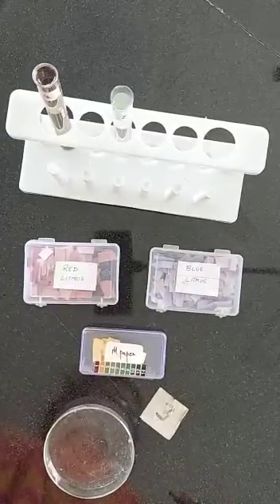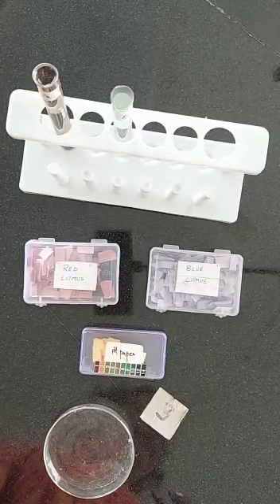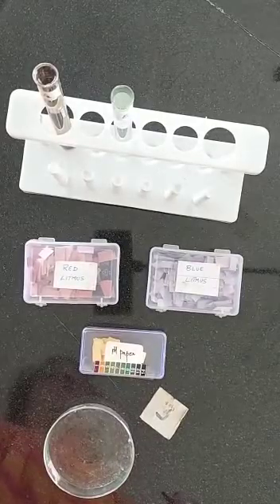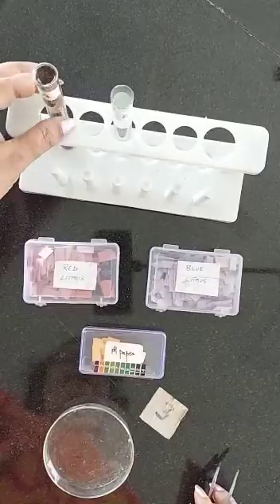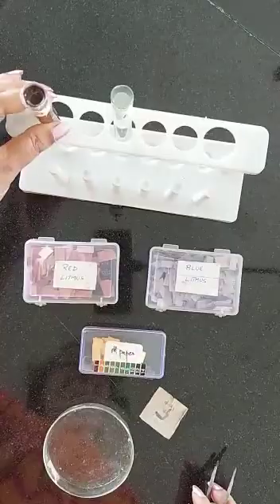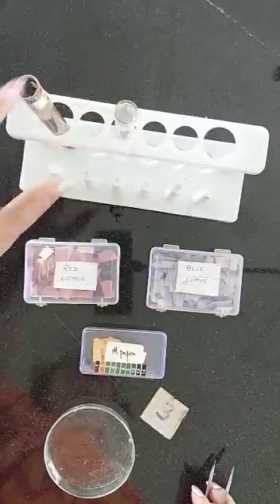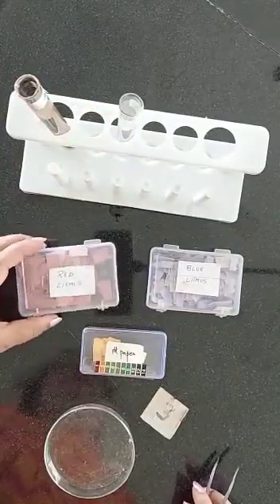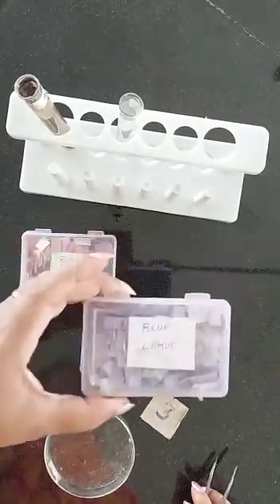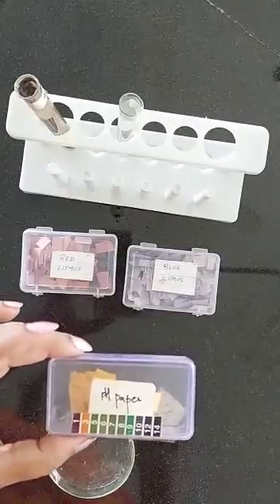Good morning children. Today we are going to study the action of litmus paper in acidic and basic solutions and to find the pH with the help of pH paper. Before we go any further, I will explain this experiment to you. You will be given two solutions, solution A and solution B, and you will be asked to find out which is acidic and which is basic. You'll be given red litmus paper, blue litmus paper, and pH paper, which is called the universal indicator. It's yellow in color.